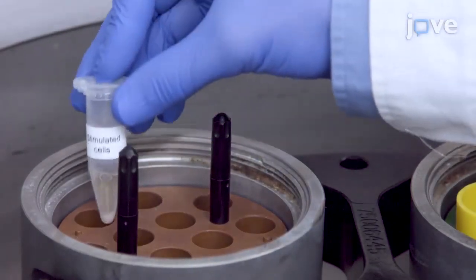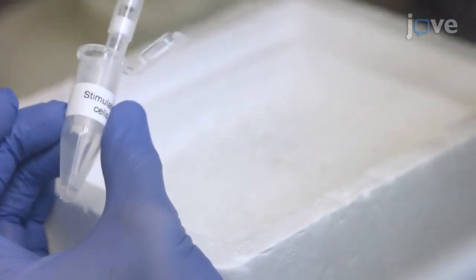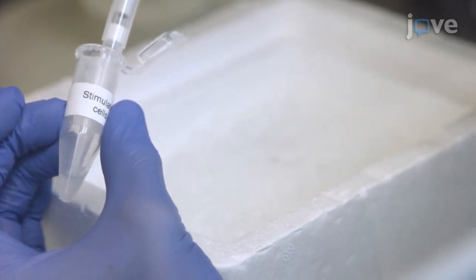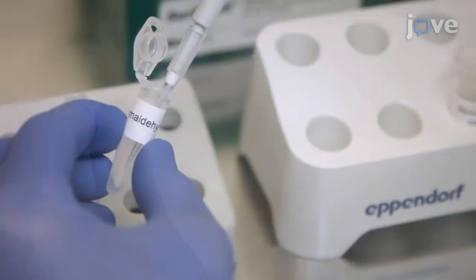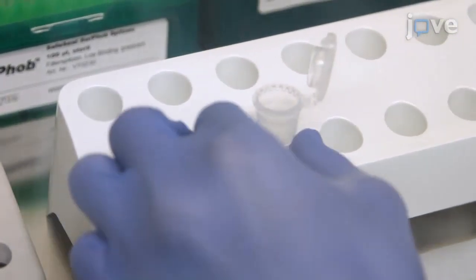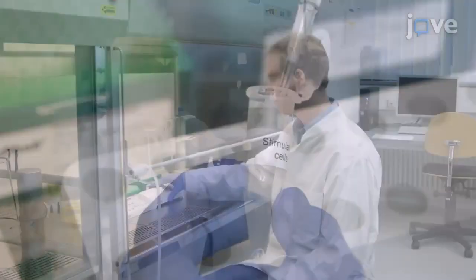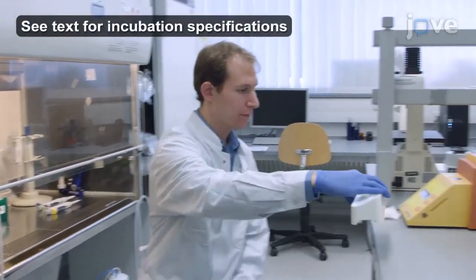Next, after the stimulation of the cells, spin the cells according to the text protocol and resuspend the cells in 500 microliters of PBS and place the tube in an ice-filled box. Add 13.5 microliters of 37% formaldehyde to the cells and mix by pipetting up and down. Then incubate the suspension at room temperature.